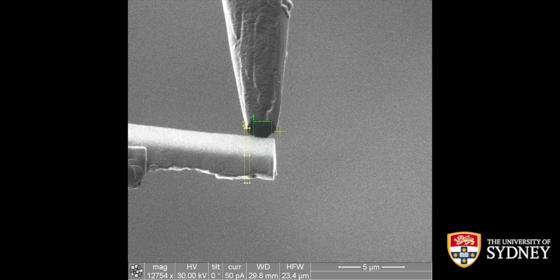The weld itself, even though here it says 50 picoamps, the weld itself is actually done at 10 picoamps, because that gives very fine welds. Again, in a later tutorial, I'll show you TEM images of what sort of difference that will actually make. Then the weld in this case will take about 5 to 6 minutes, which is a little bit longer than if you use not as good deposition conditions, but because it gives you much better sample survival rates, it is actually worth it.